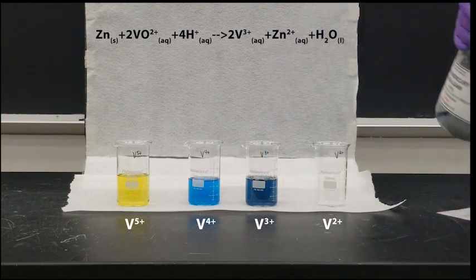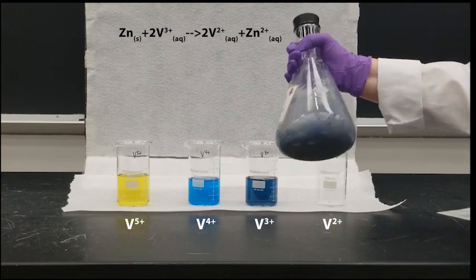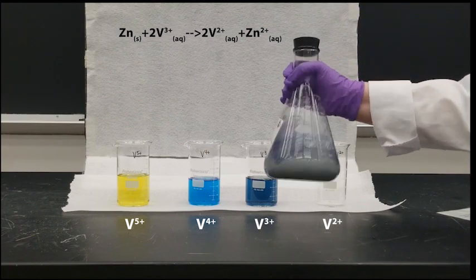To the plus three oxidation state. Finally, the last oxidation state, plus two, takes a while to get to.